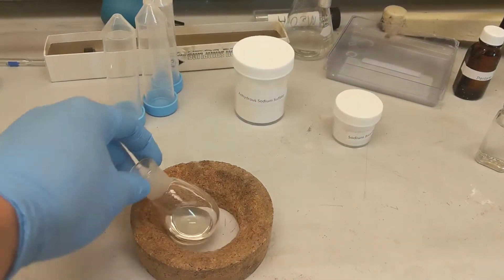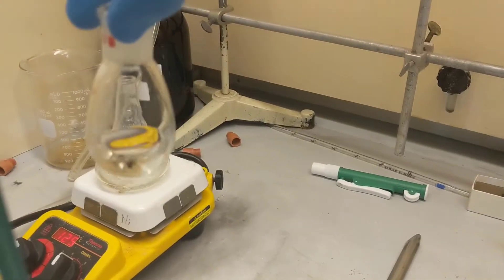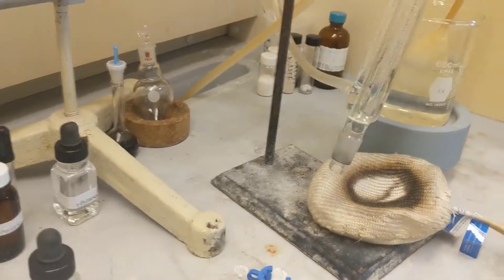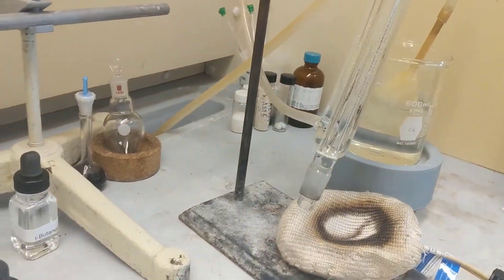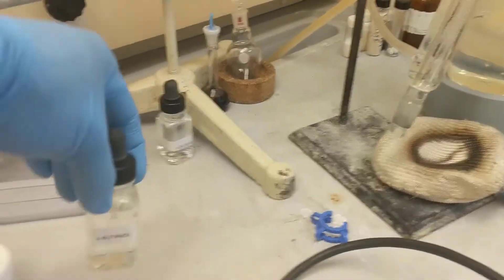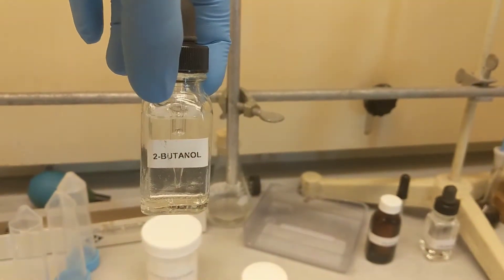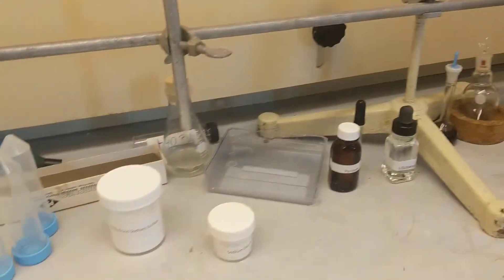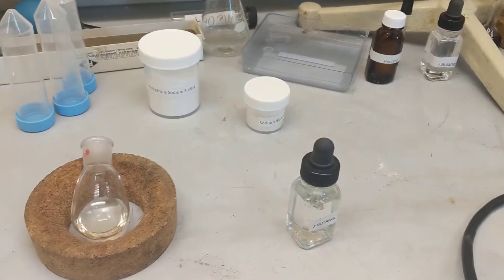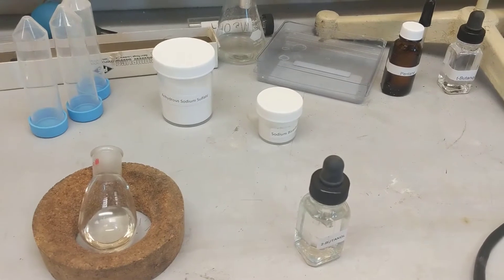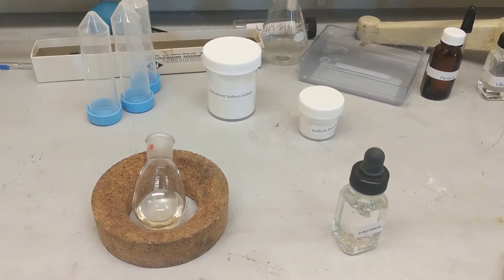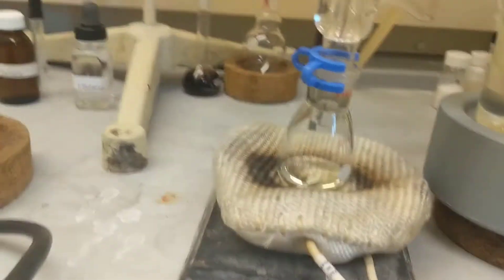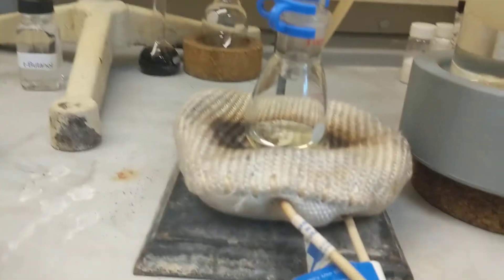I just added the nucleophilic solvent into here. There's my reflux apparatus. What I'm about to do is add 0.75 milliliters of 2-butanol, so that's 15 drops, add my boiling stone, add it to my mantle, and get it refluxing. I'll get back to you when that's done.